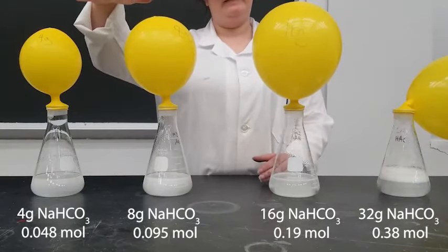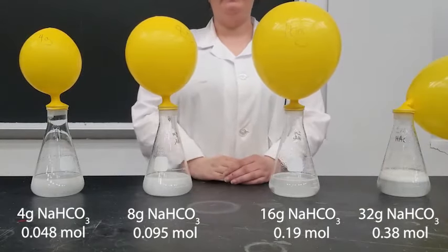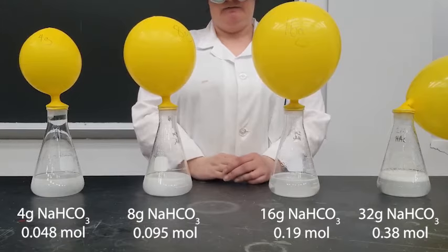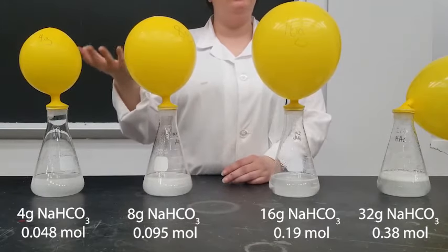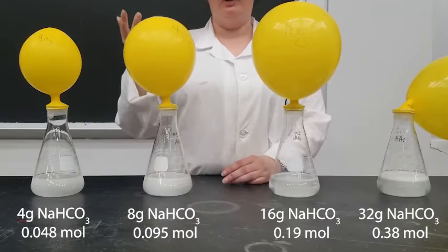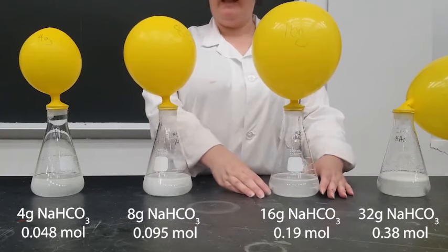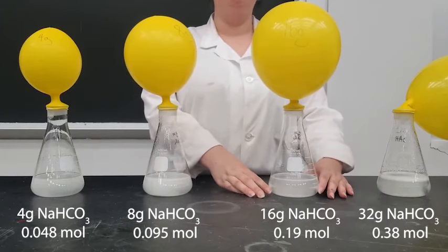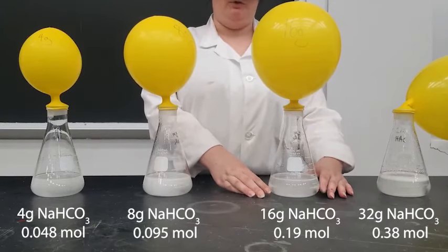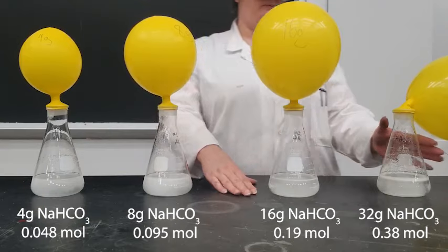In these two flasks, the sodium bicarbonate was the limiting reactant, so it could only produce as much CO2 as it had sodium bicarbonate. This flask — the 16-gram flask — is the stoichiometric ratio, so this is a perfect one-to-one ratio.